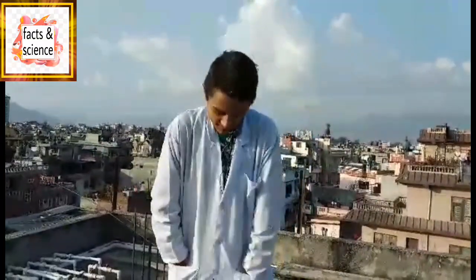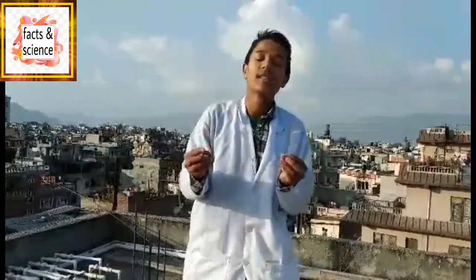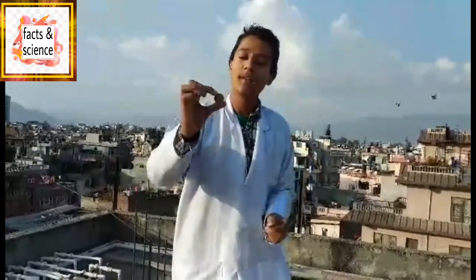Today we are going to do an experiment using one of the most important and valuable things of our life — currency. We are going to do an experiment using Indian coin and Nepali coin. This is Indian 5 rupees coin and this is Nepali 2 rupees coin.